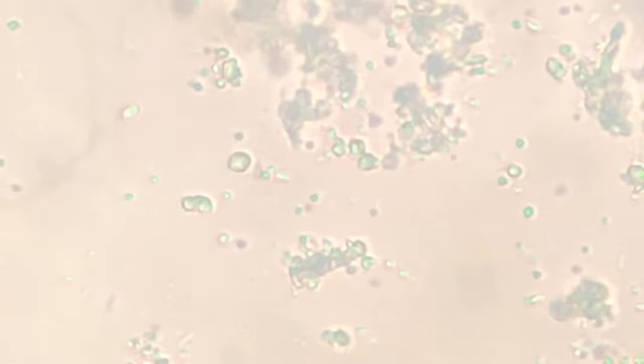Still there is a lot of white. White balance needs to be cleared. It is a random hit and try that I am trying. Bring it in the focus. Where is that fellow? Above the chlamydomonas. Above the chlamydomonas. Where is that chlamydo? It's off-centered. Where is the center now?